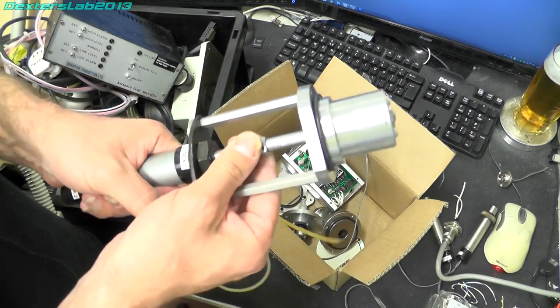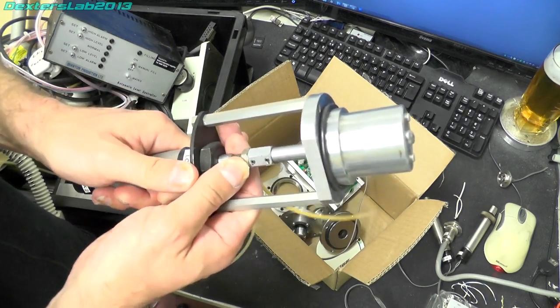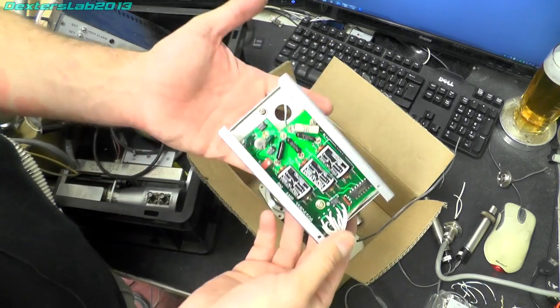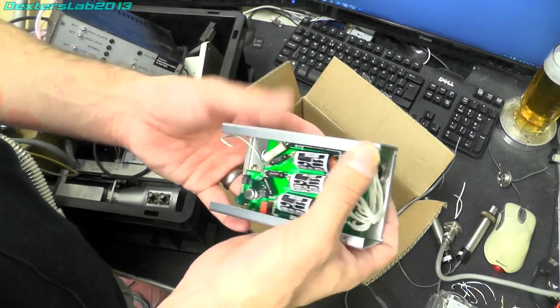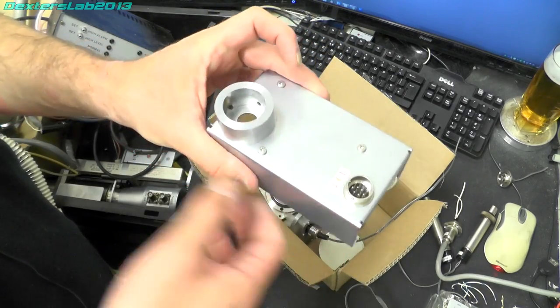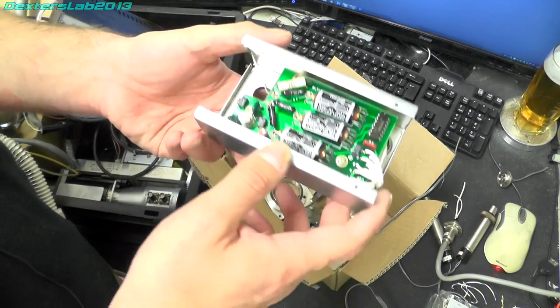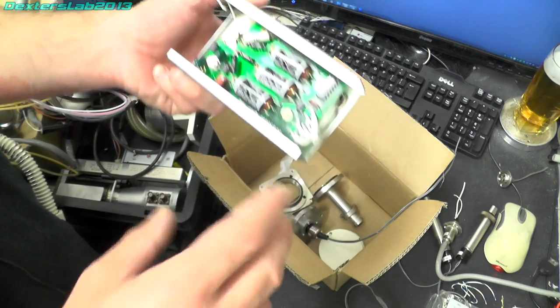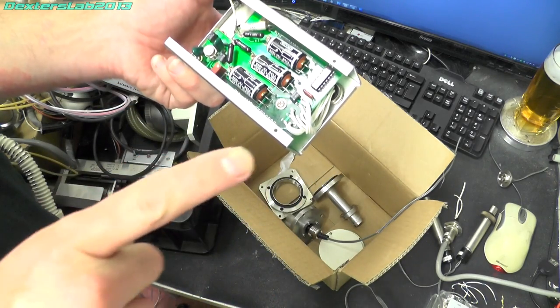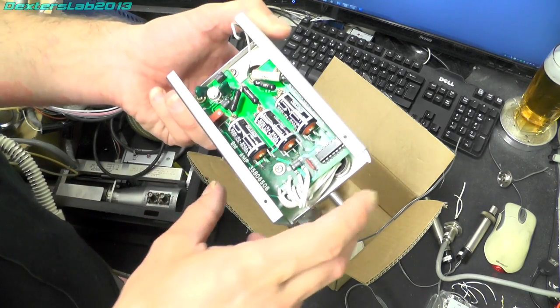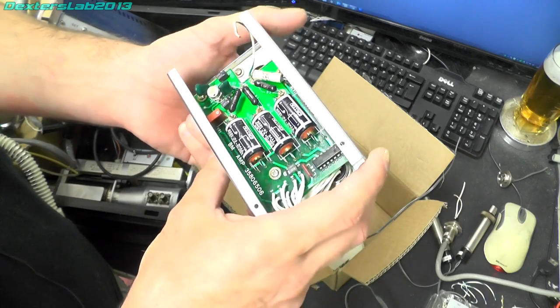So that's just a pneumatic, I think this might actually be seized up. This small box here that I've saved and have already opened, this was attached to one of the beam monitoring probes, the thing that was a little prong that actually went inside and went in place of the beam.